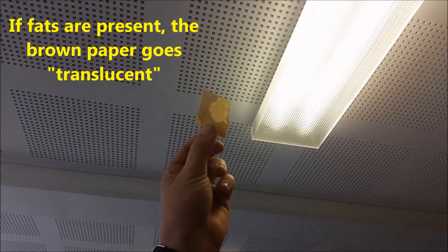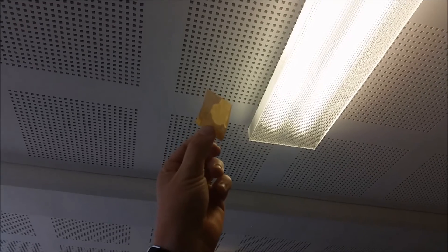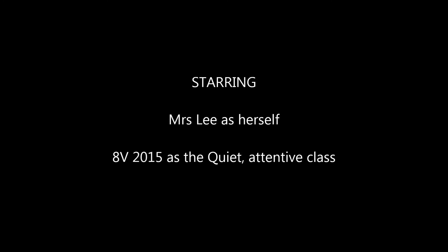So again, I don't know if many people can actually see it, I will come around, but we describe it as being translucent.